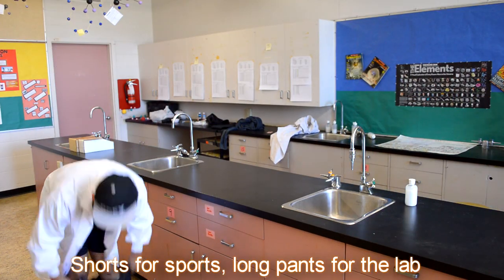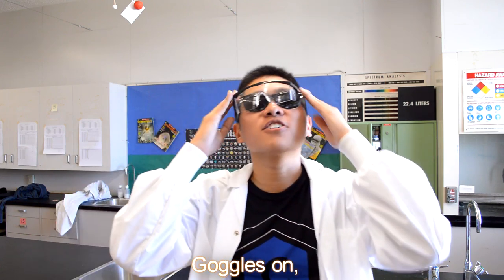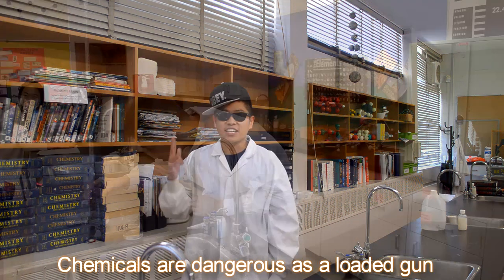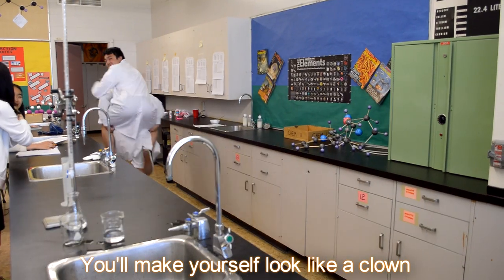Shorts for sports, long pants for the lab, no sandals or long hair. If you don't have goggles on, you better do your work elsewhere. The lab is not a place for fun. Chemicals are dangerous as a loaded gun. No running, jumping, or horsing around. You'll make yourself look like a clown.